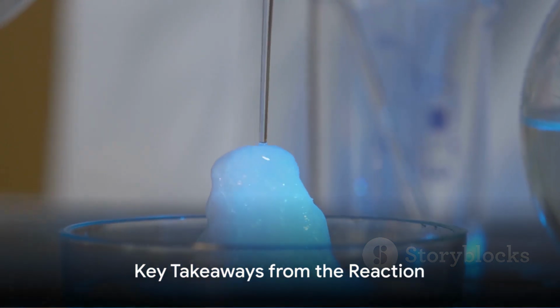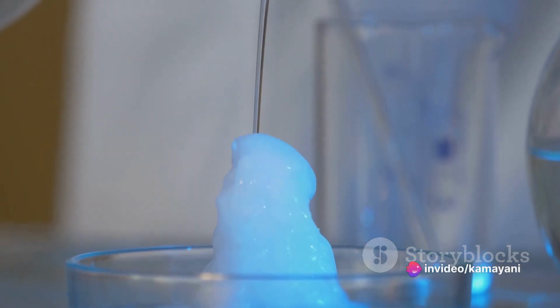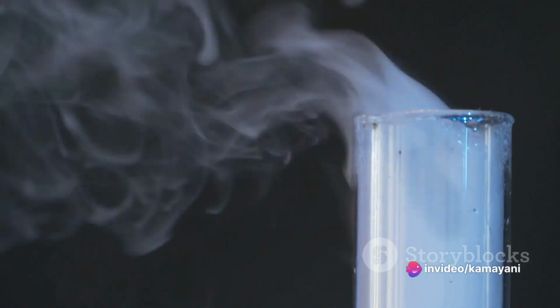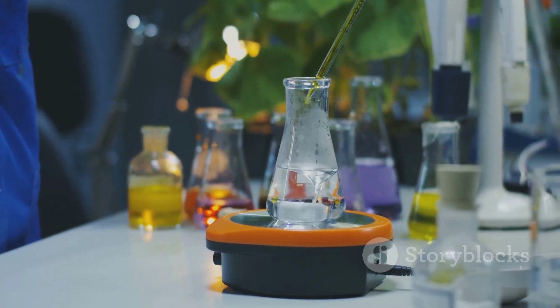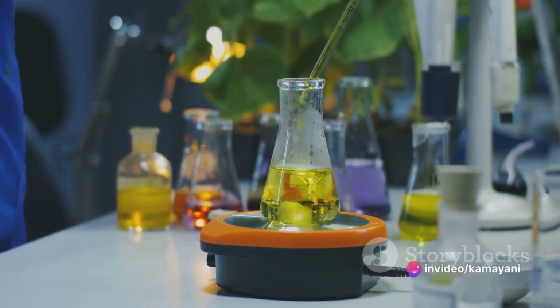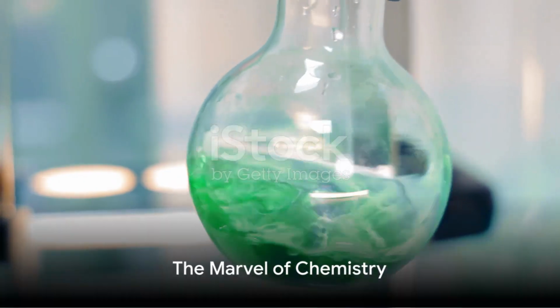So, what are the key takeaways from this reaction? Firstly, the change in the color of the solution from blue to green signifies the formation of iron sulfate. Secondly, the coating of copper on the iron nail is an indication of the displacement of copper by iron. Lastly, this reaction is an example of a single displacement reaction, where a more reactive element displaces a less reactive one from its compound. Isn't chemistry a marvel?